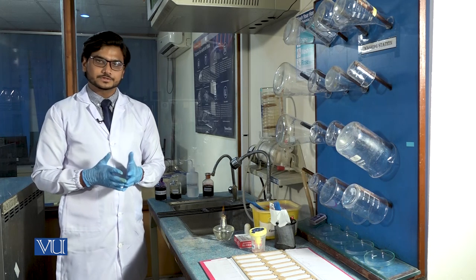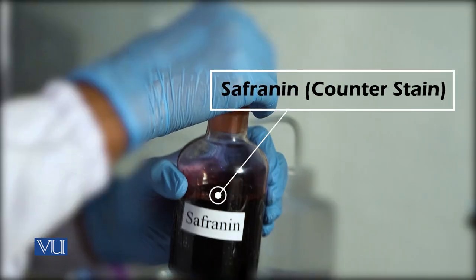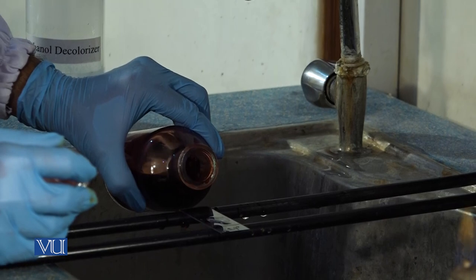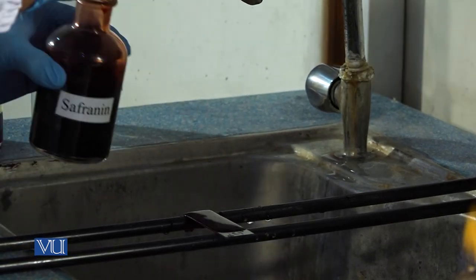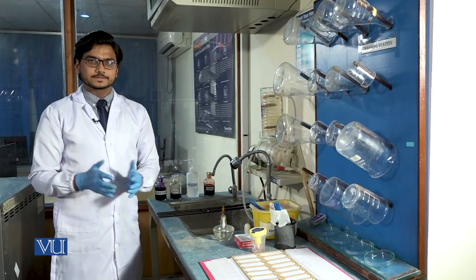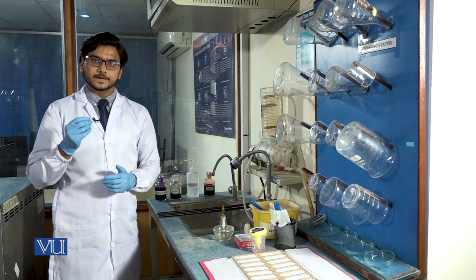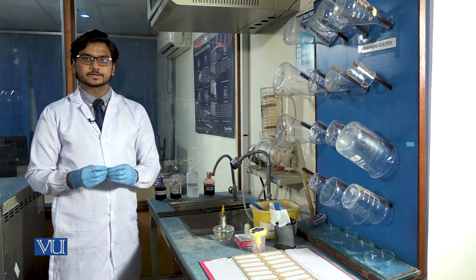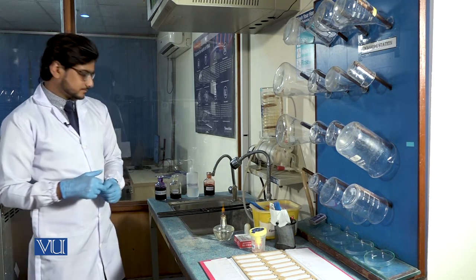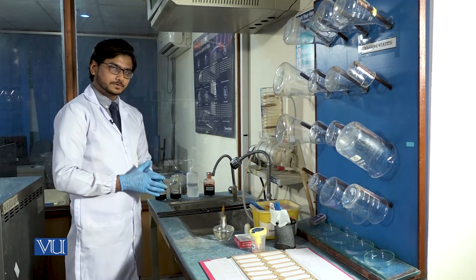After applying the decolorizer and washing the slide with tap water, we will apply the counter stain which is known as safranine for one minute. Gram negative bacteria will retain the safranine, that is why gram negative bacteria appear pink in color during microscopy. After one minute, we wash the slide with tap water.